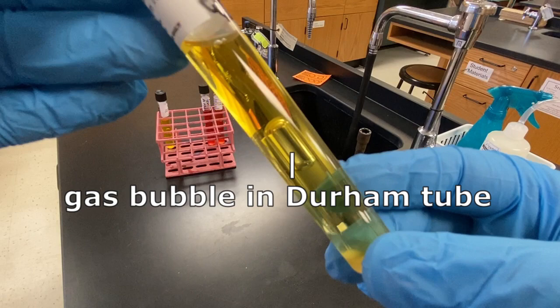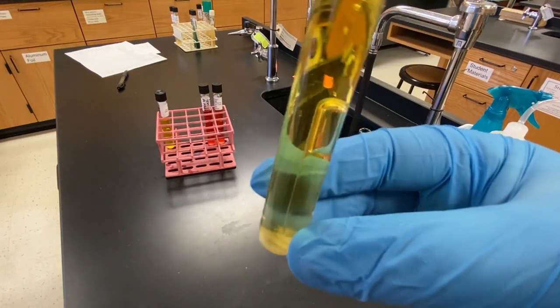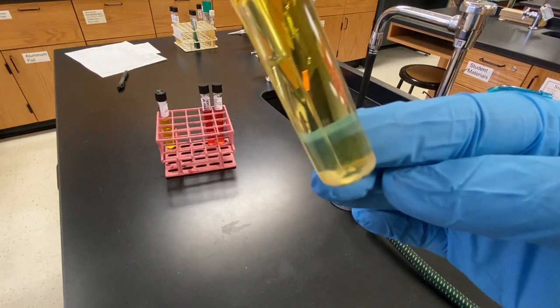When testing the unknowns, we are only testing the ability of the unknown to produce acid from fermenting the sugar. Gas production is not considered in the unknown test key table.